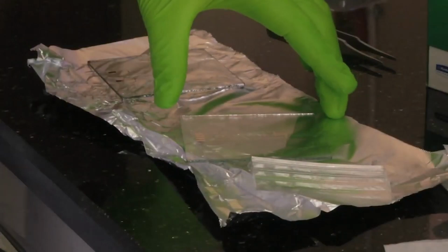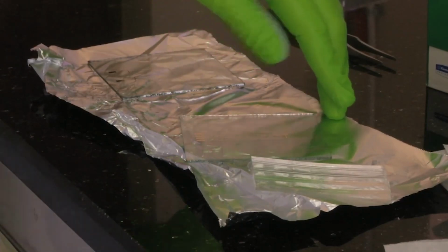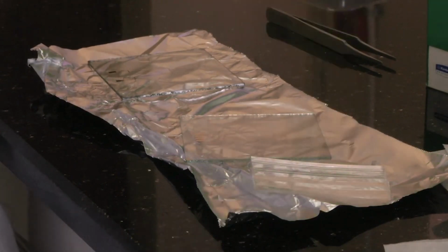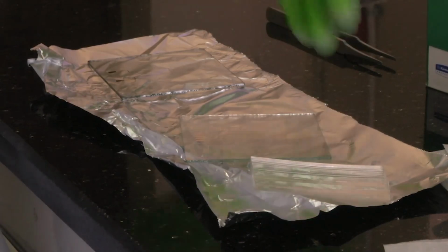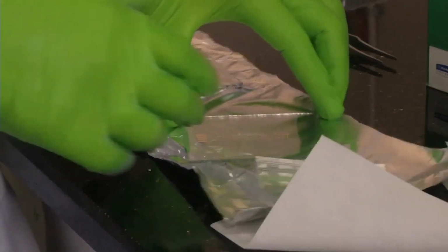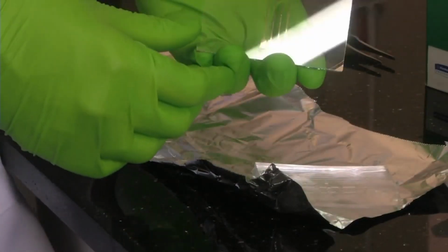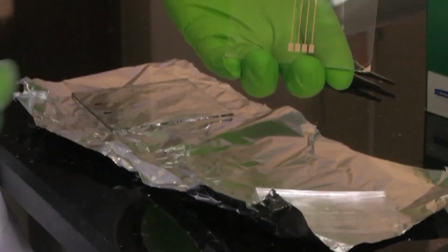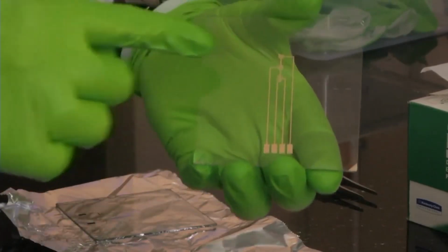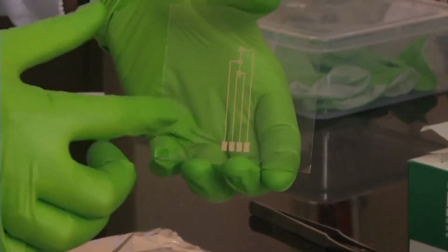The substrate might have sensors, which may be electrodes, heaters, or any other metal or material deposited on your substrate, or it might be a very clean glass slide also, and your device might work on optical measurement basis alone. So you can bond your PDMS with glass or with, say, a silicon wafer. So here we have a glass slide with gold electrodes patterned on it using photolithography. Are you able to see clearly? So this is a glass slide where we have patterned gold electrodes using photolithography.